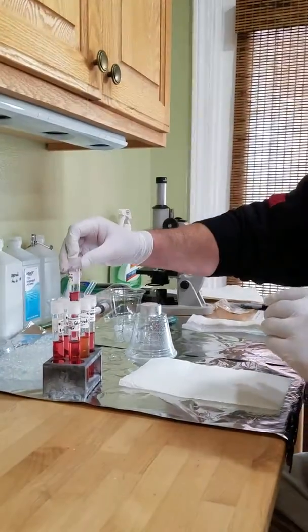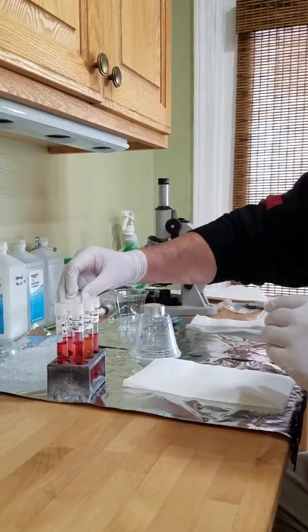We're going to incubate these for 12 hours. If not, we can go an additional 4, so a total of 16 hours. We'll get our results, see if we got some gas, see if our pH indicators have actually given us a positive result, and then we can make our determination and document everything. So I'll see if I get a change on that one test tube that I have a little bit of discrepancy with, but we'll do the best I can. That's what I got, so we have to work with what we have.